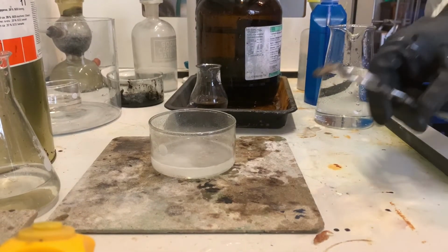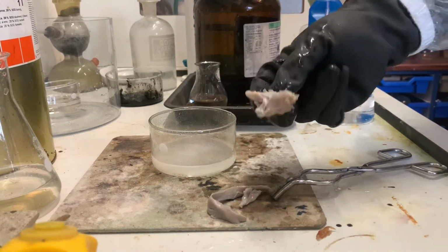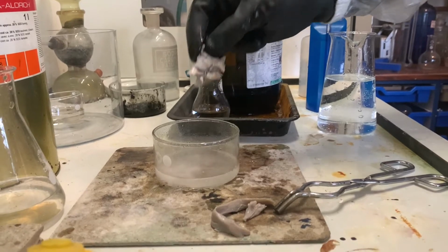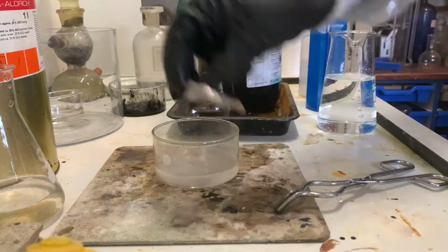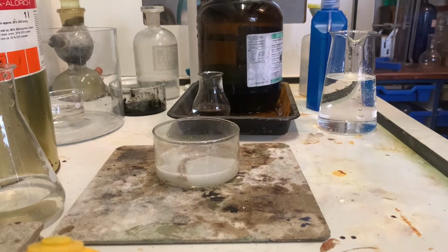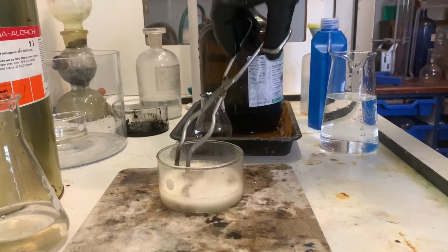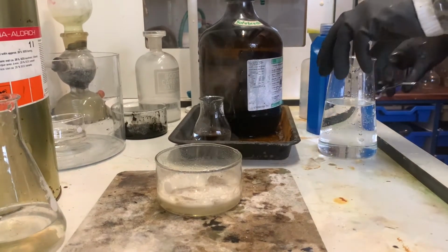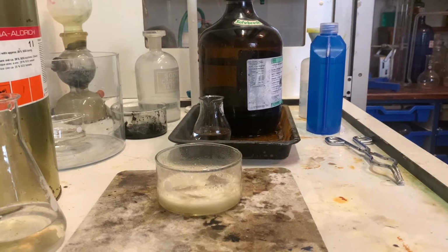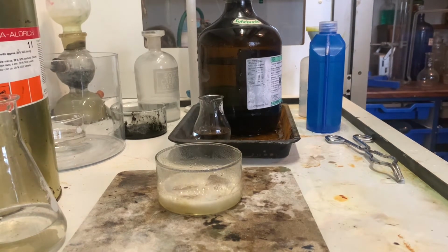Now we're going to add some of last night's chicken in the form of protein, which would be a good demonstration of what would happen if concentrated sulfuric acid was to touch your skin and how easily your skin would dissolve. So you have to treat concentrated sulfuric acid with enormous respect, and you're going to see why. As you can see, the reaction with the skin of the chicken is instantaneous.